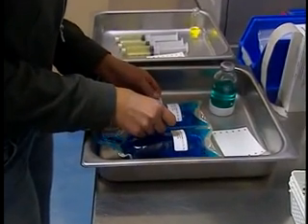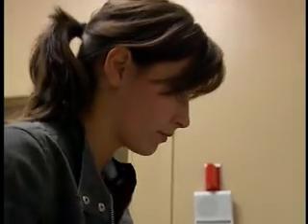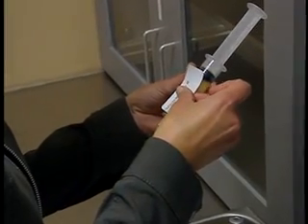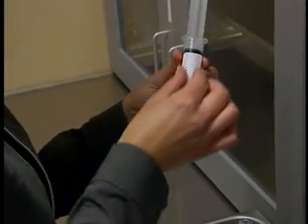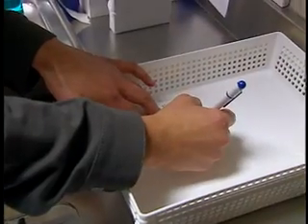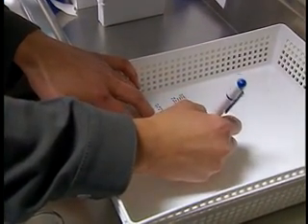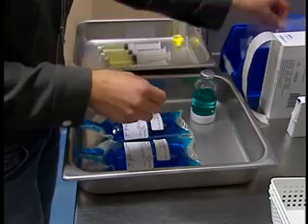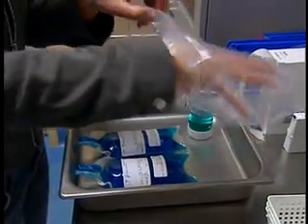Label prepared products in accordance with facility standards, making sure not to hide the name, expiry date, or graduations. Place your initials on the label and have it initialed by the person who checked the preparation.